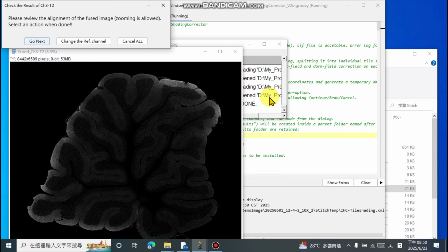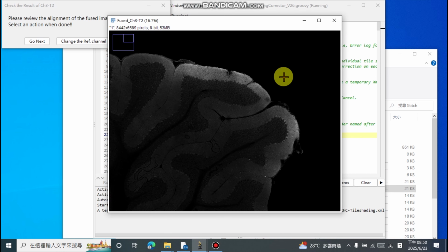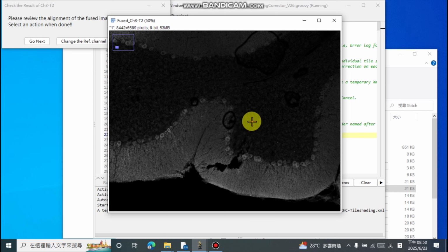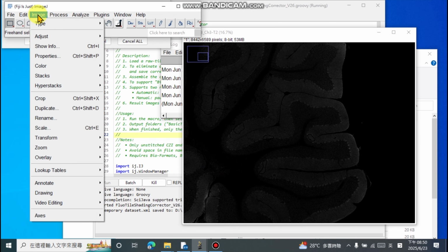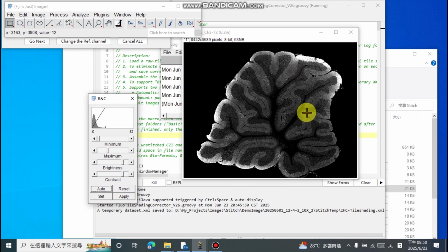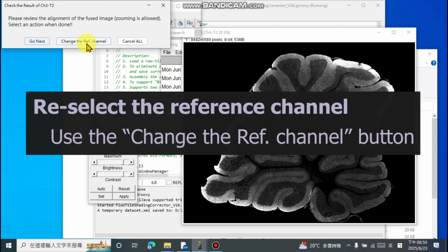After stitching is complete, a review window will pop up. At that point, you can use the mouse wheel to zoom in and out to check if there are any seams in the image. Or you can adjust brightness and contrast to inspect the stitching quality in more detail. If you find that the stitching quality is poor, or if there are uneven brightness levels or visible seams, you can also click to change the reference channel, to reselect the reference channel for stitching.